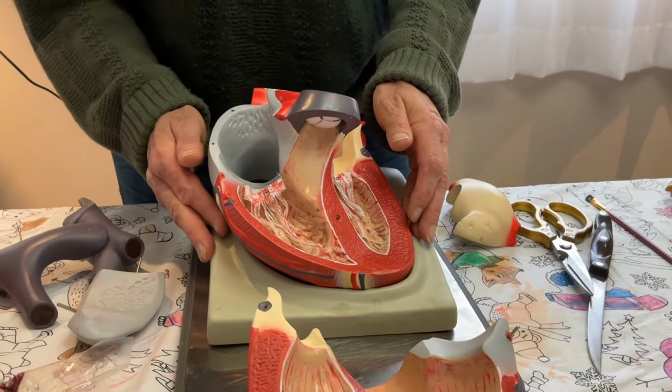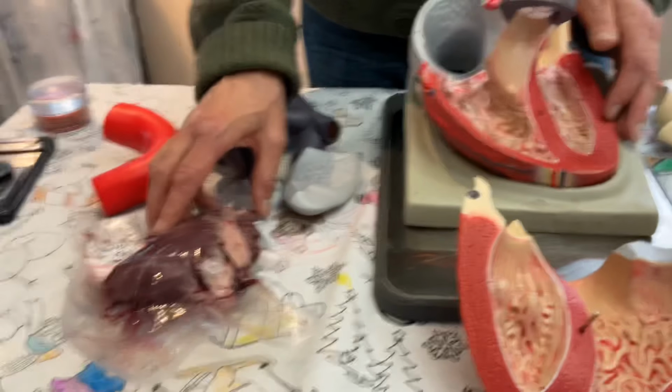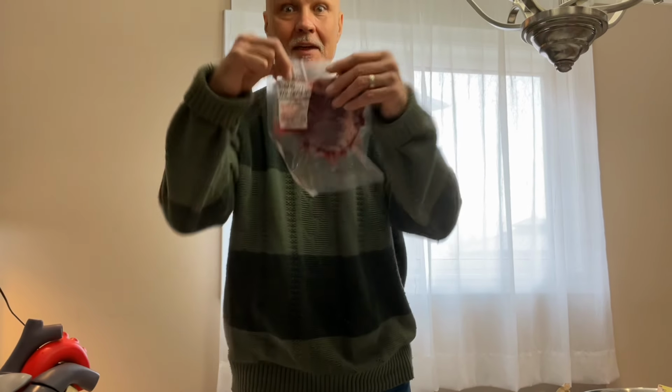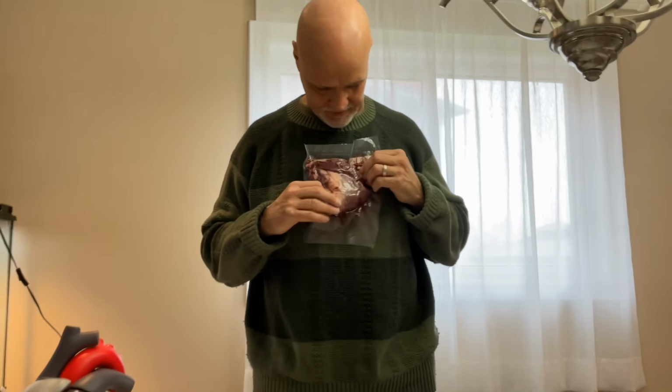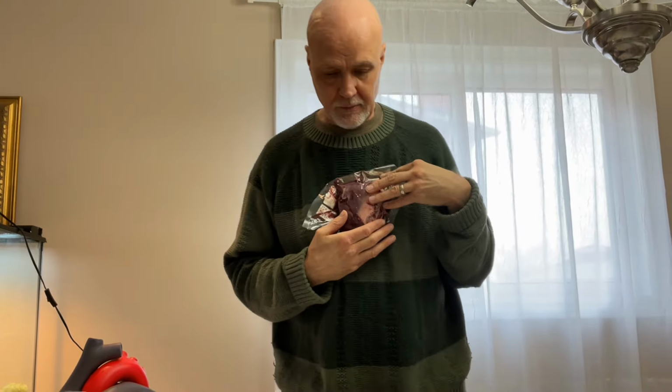We're now going to move on to the real heart. Okay, my friends, now we are moving on to the actual pig's heart. And I'm pretty excited about this. The thing about a pig's heart that's kind of cool is it really is about the size of a human heart. So if you want to know how big your heart is, just take a fist and put your other hand over it. And it's roughly the size of your heart, and this is where it sits. You can see it sits in nicely. If you're a smaller person, the heart's going to be a little bit smaller.